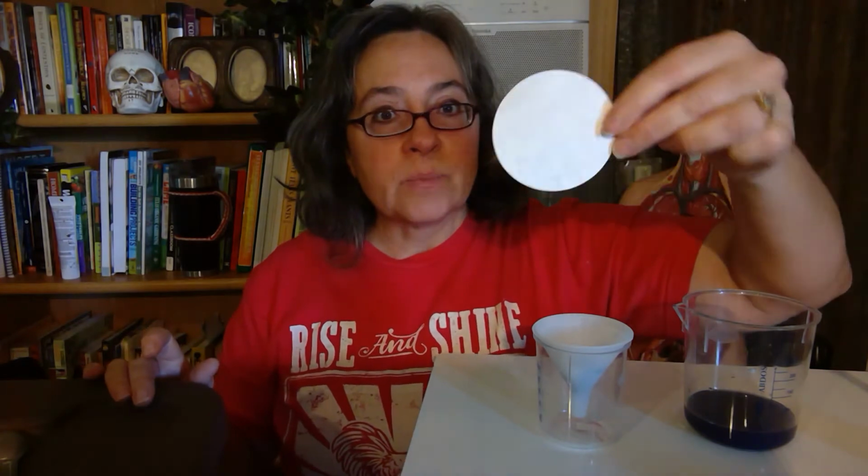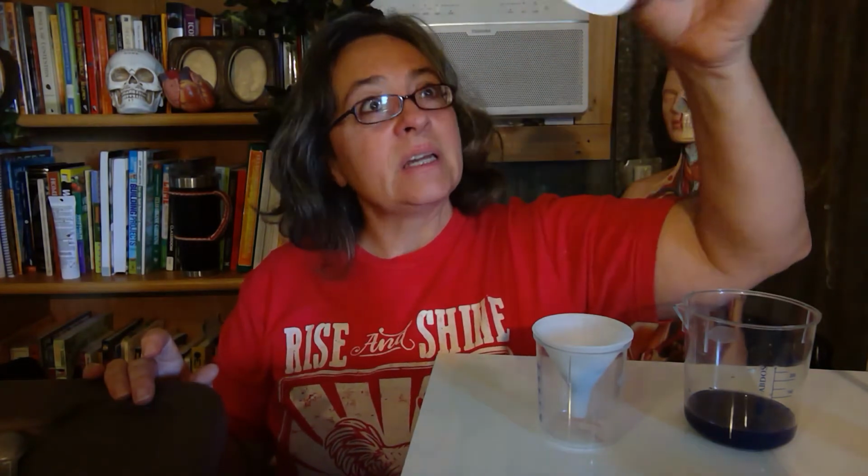Remember, I talked to you about how big the starch molecule is. It's a macromolecule. It's too big to go through the holes in this filter paper. This filter paper has holes in it. You can't really see it, but if you were in person, you could see a little bit through it because of the holes. But these holes are too small for the starch molecule to go through. If the holes were big, then you would be seeing purple liquid coming through. But look, it's still very clear.